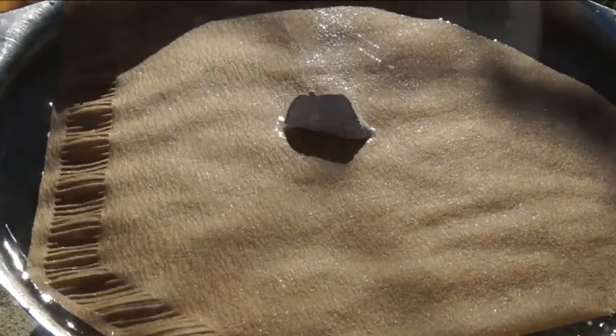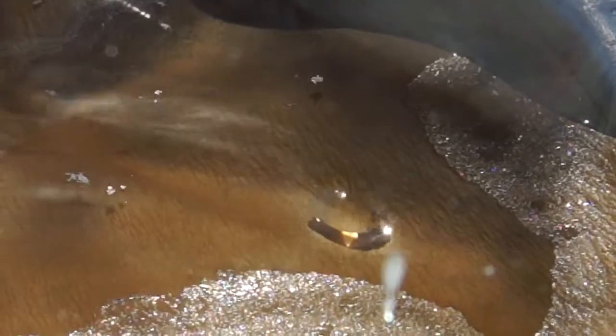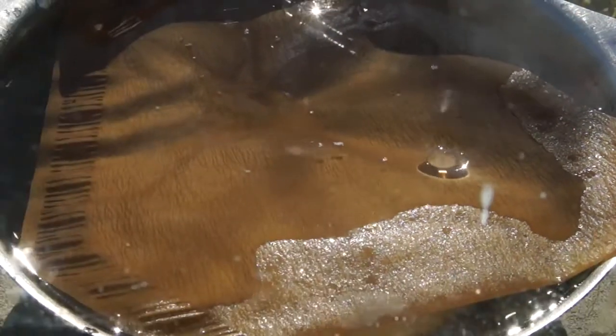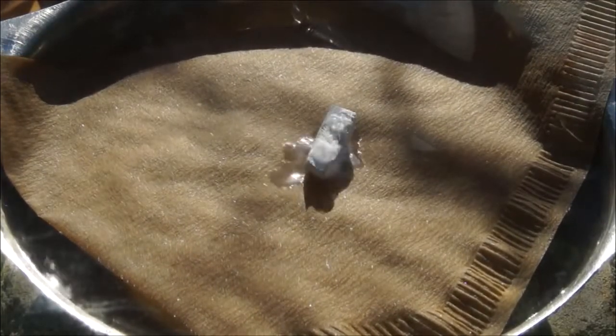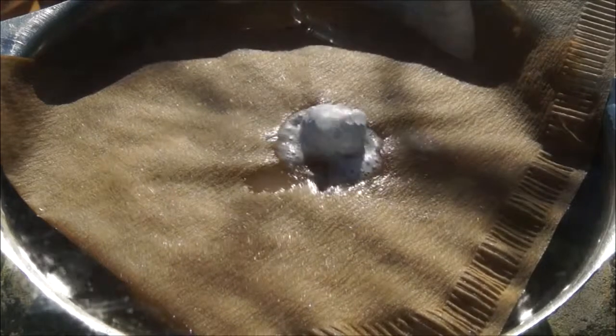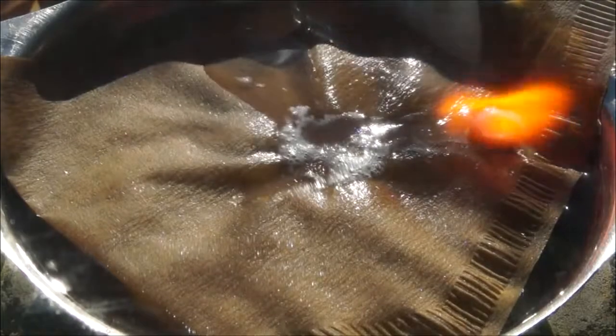I did this experiment several times and every time the same result was achieved. First, the droplets of sodium ignite, then the burning stops. And then, for a reason unknown to me, a droplet of unknown substance is formed, which floats on the surface of water. Whether we are dealing with transparent sodium or some other substance — such as sodium hydroxide or a sodium hydroxide mixture with water in unknown proportions — why the droplet becomes perfectly clear, I still cannot find the answer to this question.